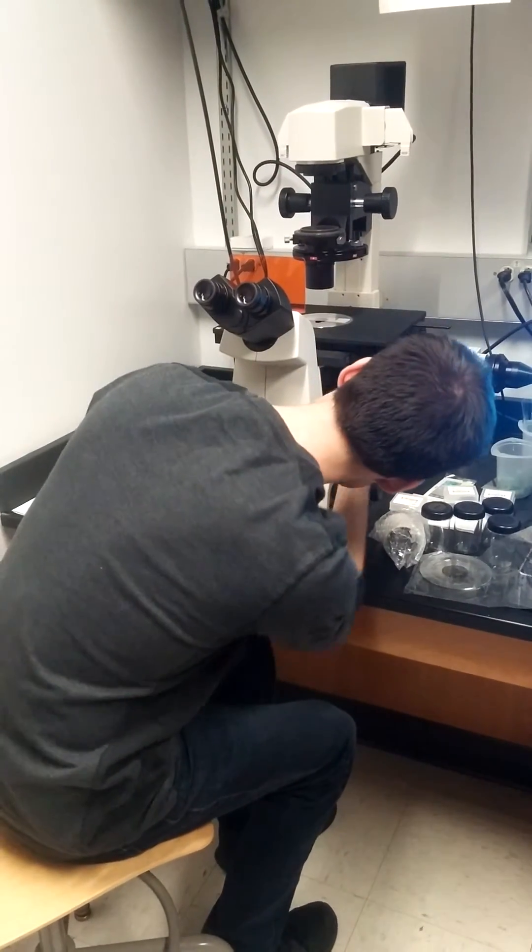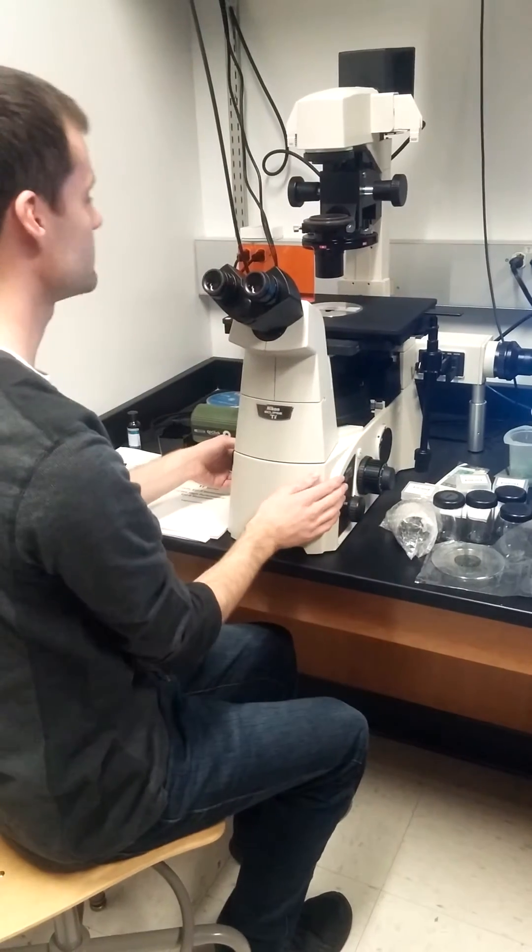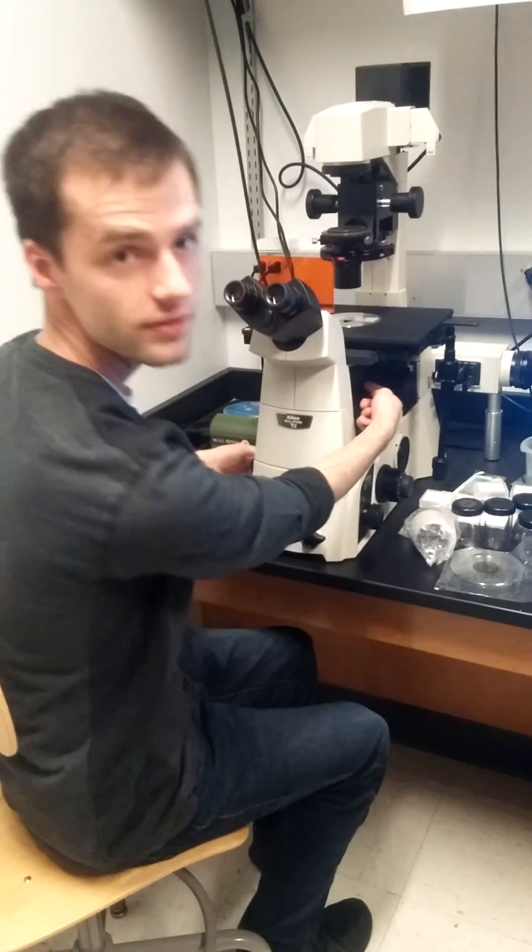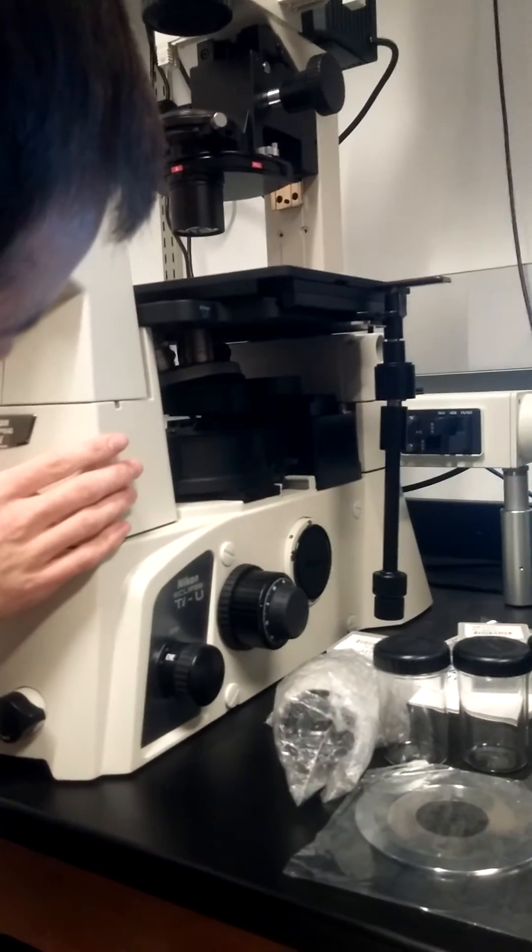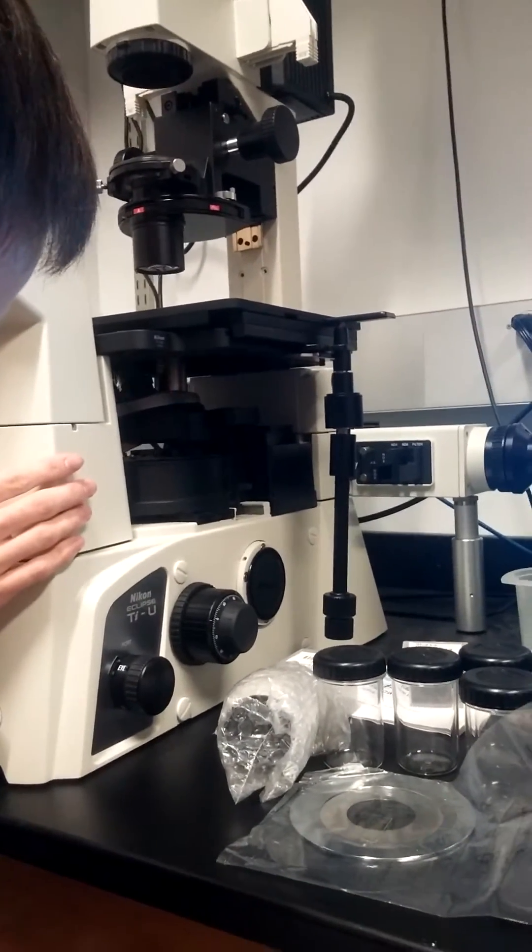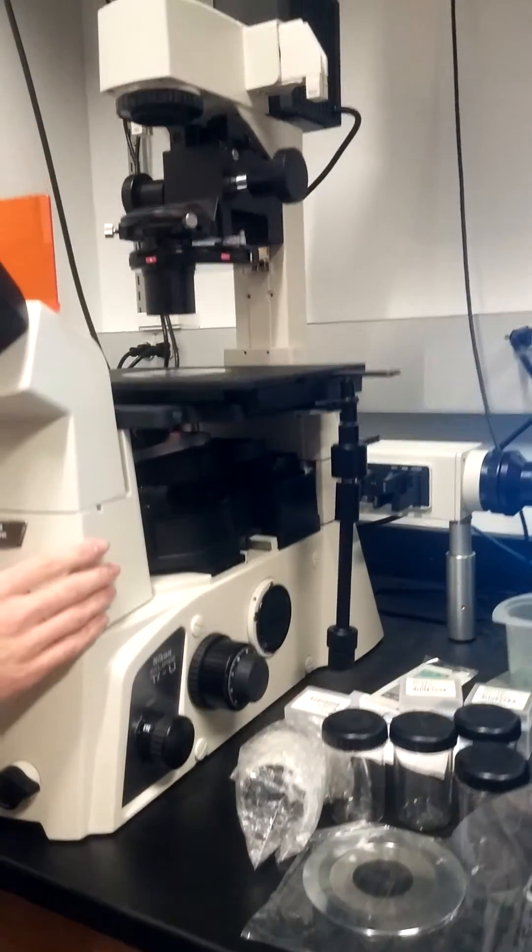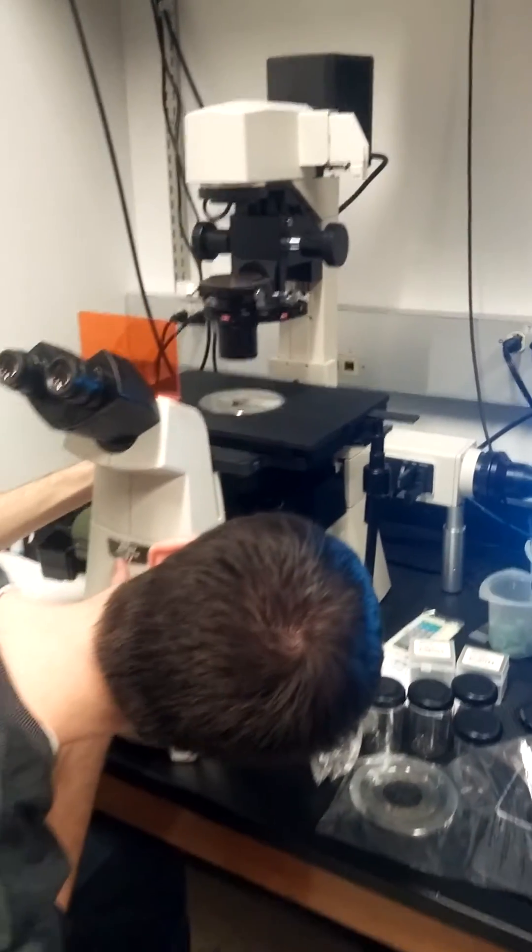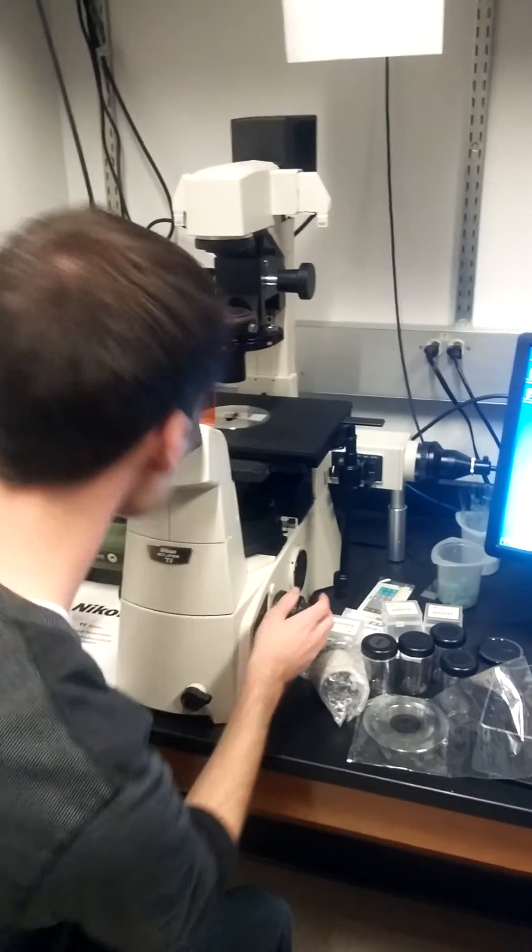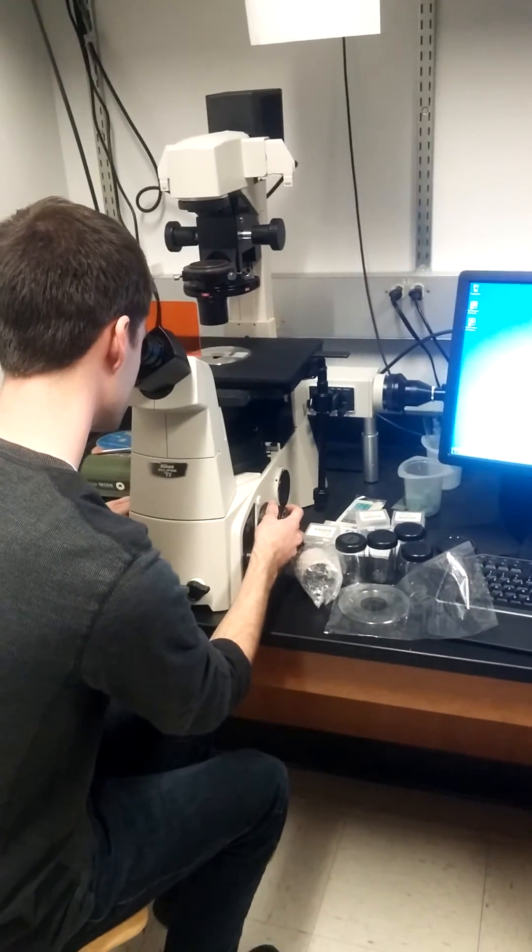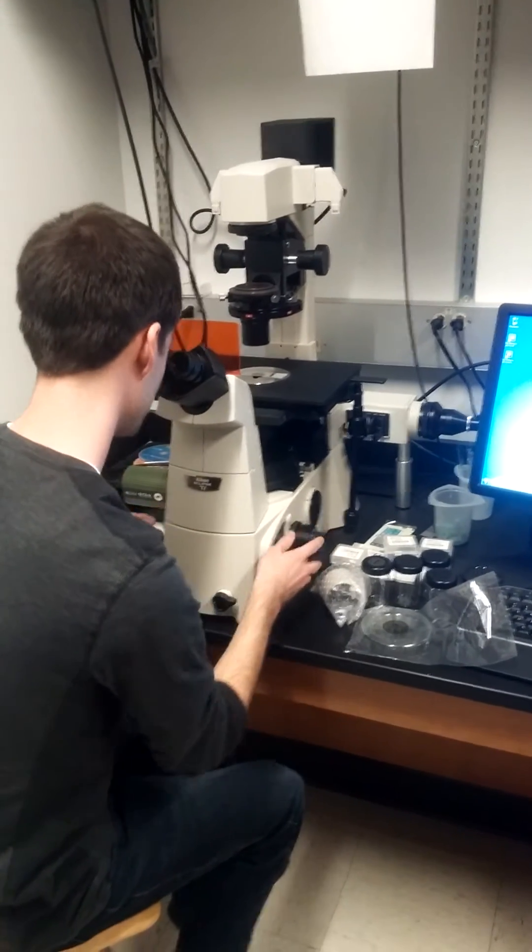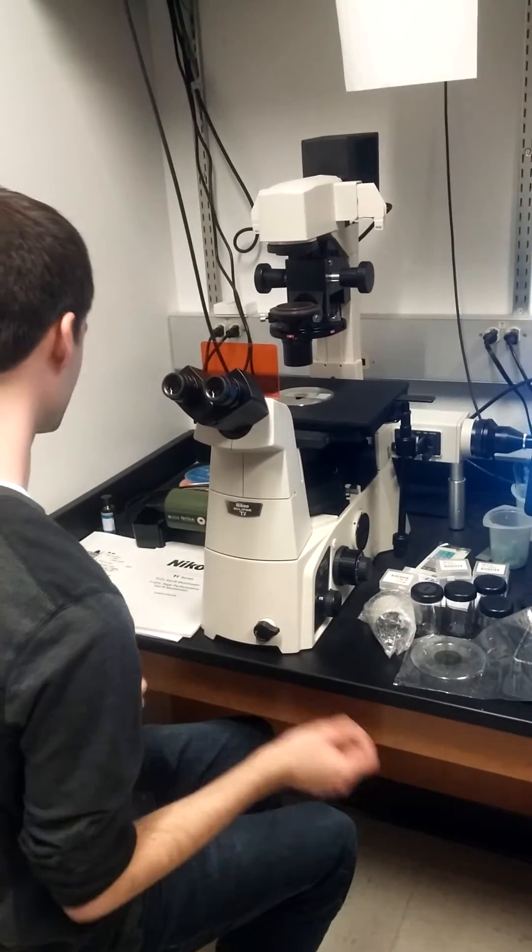Right now I'm in a 10X objective. The objectives are underneath the stage here. And I just rotate to the objective I want by turning this around. And you'll feel them click into place when they're in the right position. So let's get this situated. Great, that looks focused.